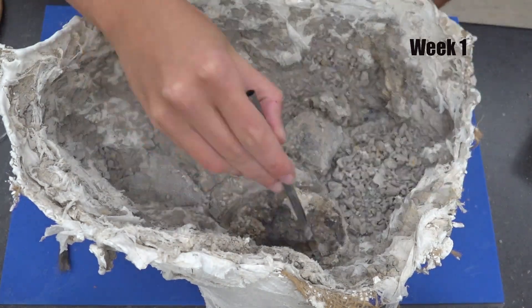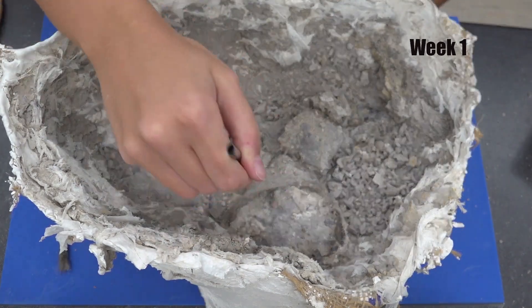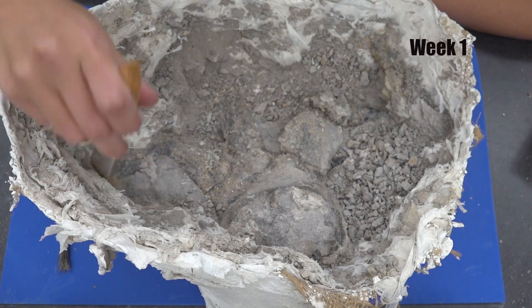I'm using acetone to identify what is bone and what is rock. Since acetone dries quickly, I reapply it a few times to help loosen or dry out any mud left on the bone.